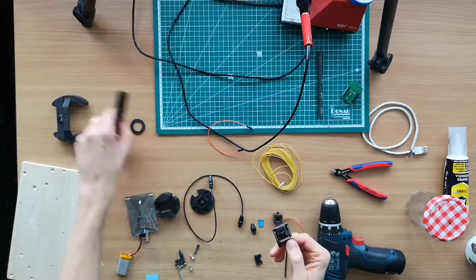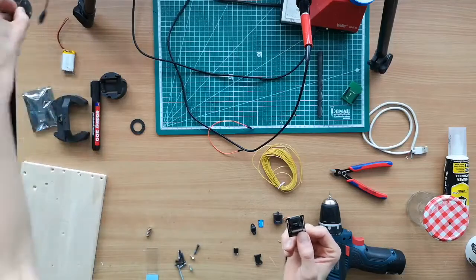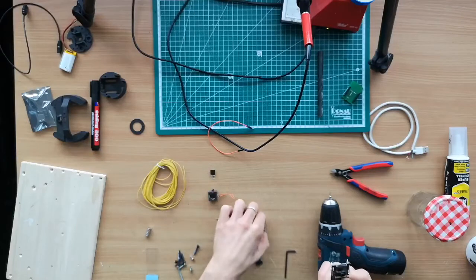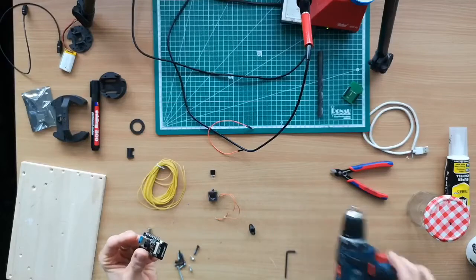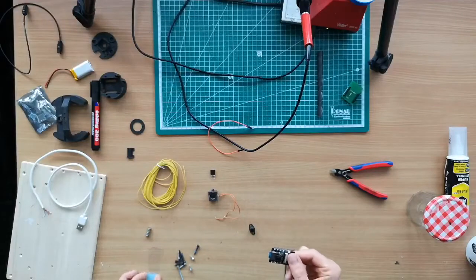We have a bunch of parts we will just put aside for the moment. What we are doing right now is connecting some wires to the ESP32, which are essentially controlling the lens here. This is for focusing. For this, you would need a transistor. You can also already plug in the micro SD card. And we also connect a USB cable to your battery. That's also powering the device. And this is happening right now.